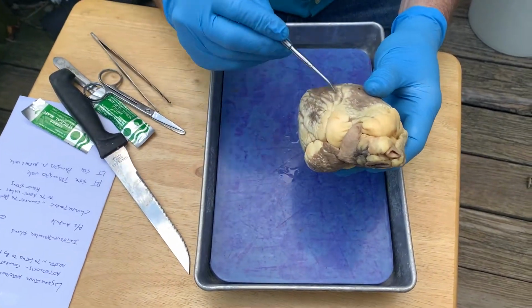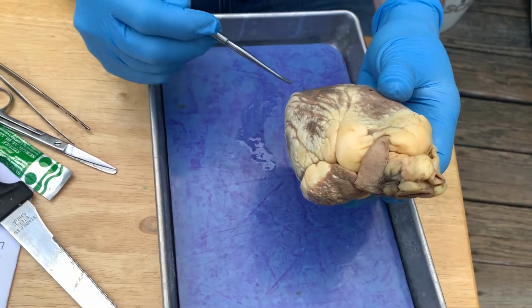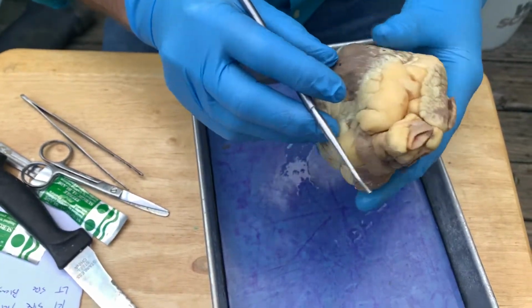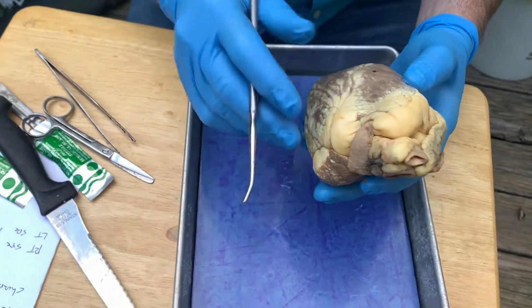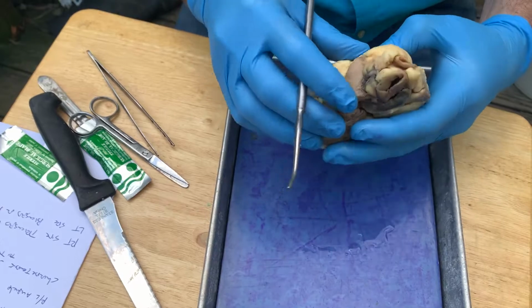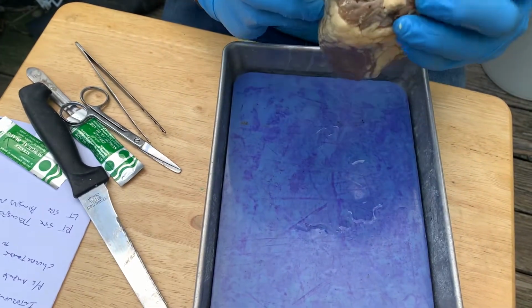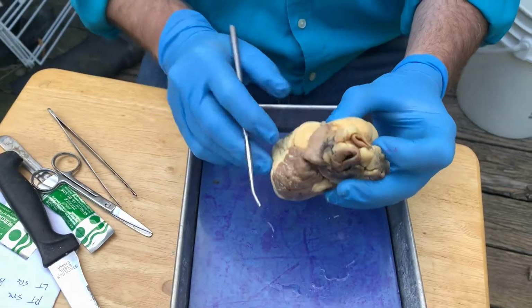we have the left ventricle, which we'll see when we cut open is the largest ventricle and has the thickest part of the heart. Up here, we have the right ventricle, okay? So this is the interventricular sulcus, which divides the left and right ventricles. On the top here, we have the atria, and these little parts that stick out from the top, you can see one over here, and you can see one here, okay? These are the right and left auricles.